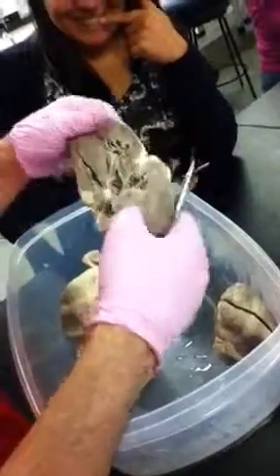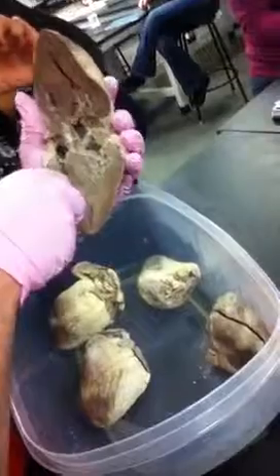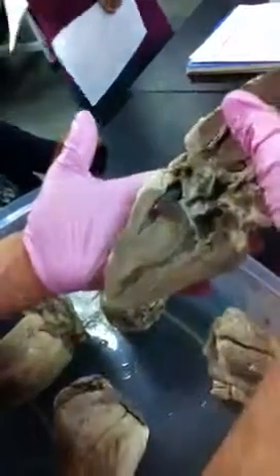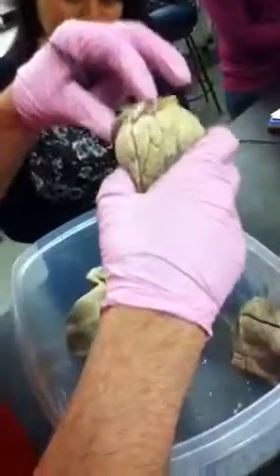Anything else on here? That's it. So here's a nice picture. You can clearly see this is the right atrium. If I stuck this vessel in here, it's going into the right atrium, superior vena cava, or you could just put vena cava, because we can't really tell if it's superior. You just want to be able to distinguish a right atrium from a right ventricle. And then the little auricles, you'll have a little tag on that? Yeah, so auricles would be these little guys right up here.